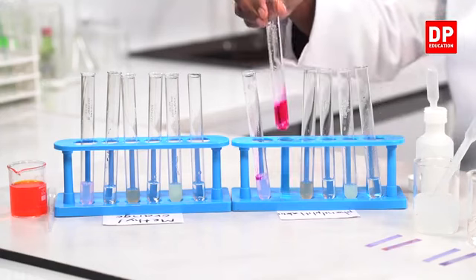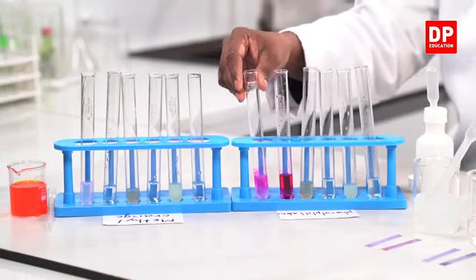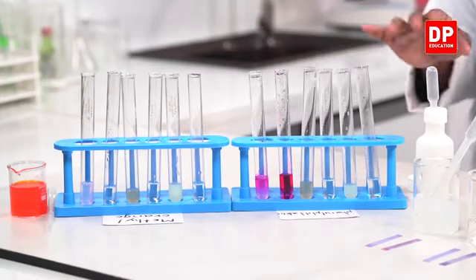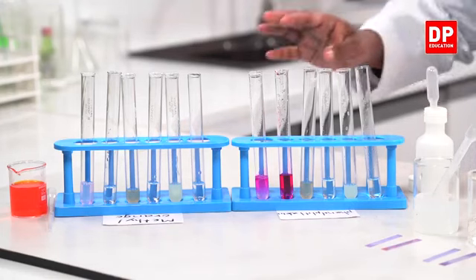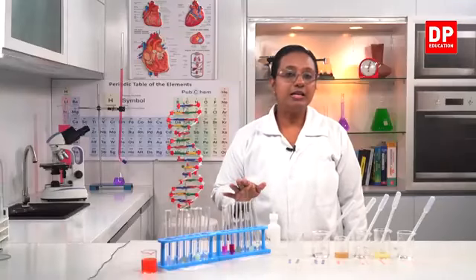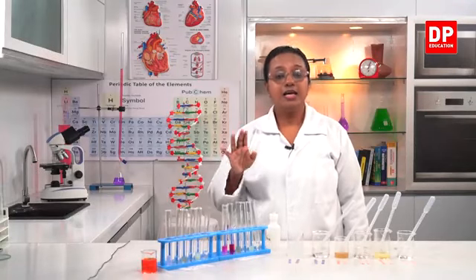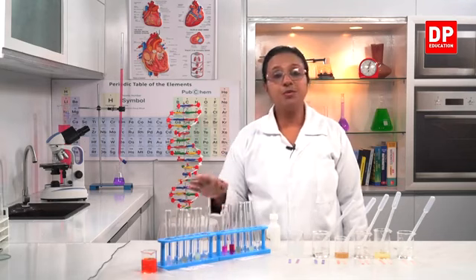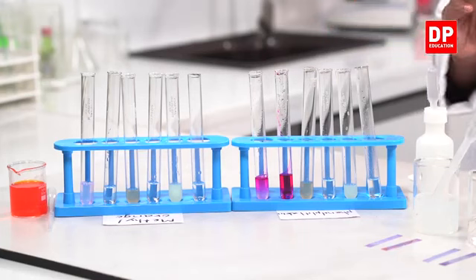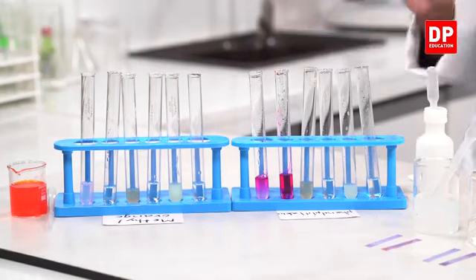So here you can see the color of sodium hydroxide, that is dilute, and also the soap solutions. In both it turns to pink color, like a purplish pink color solution. So phenolphthalein indicator is usually colorless. In a base it turns from colorless to pink. But in acids, it remains the same. It's a colorless solution in acids. So you all can observe the changes clearly.